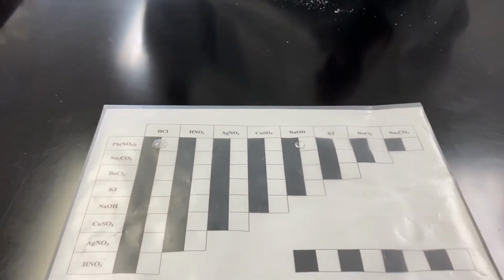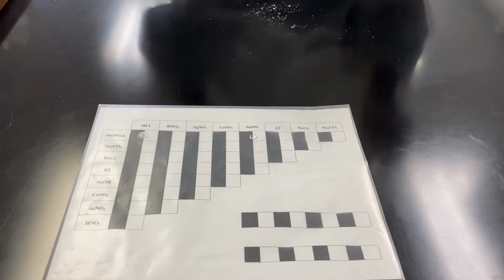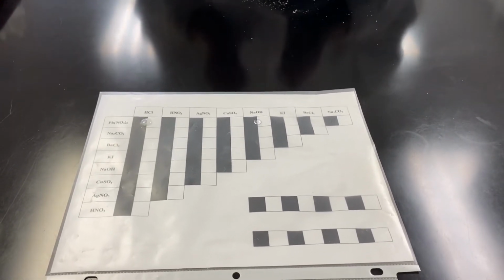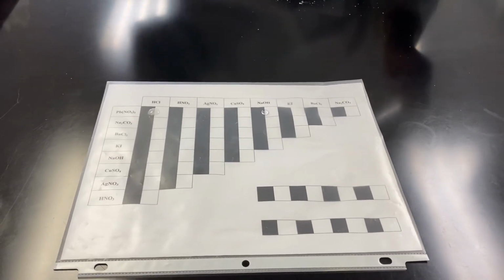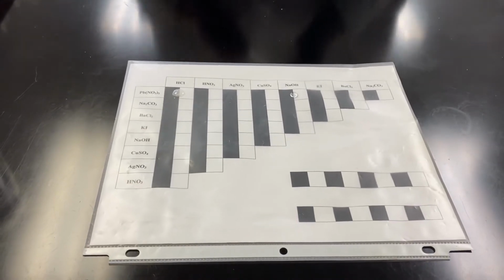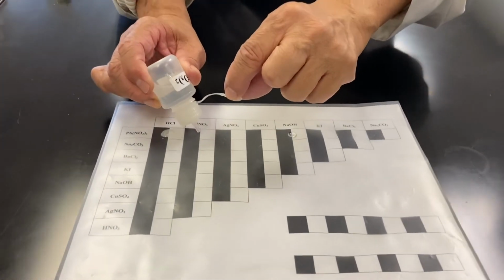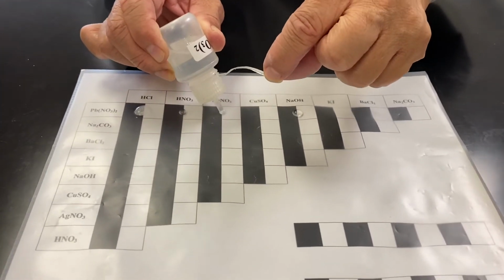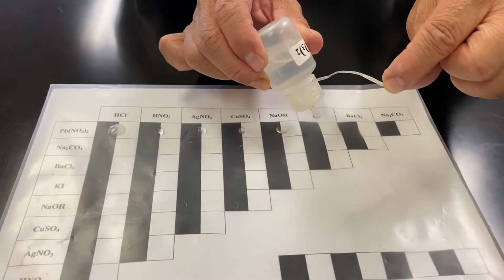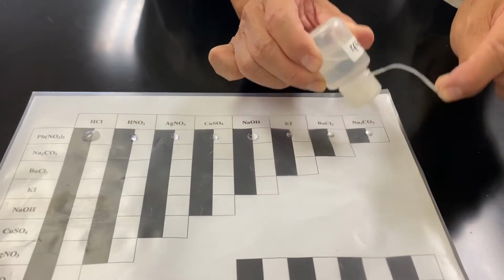That raises a question: which observations should we take into our page 33? We take both. PPT first and clear colorless solution second, row by row. So what I meant is we're going to have 1 drop, 1 drop, 1 drop, and 1 drop, 1 drop, 1 drop.